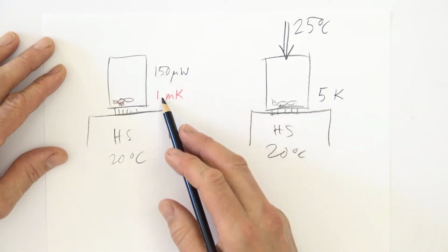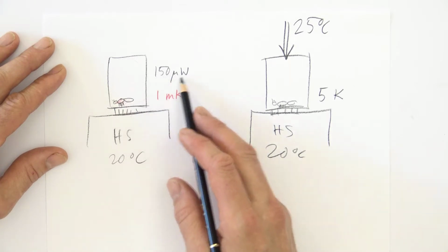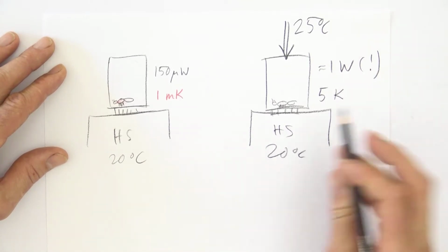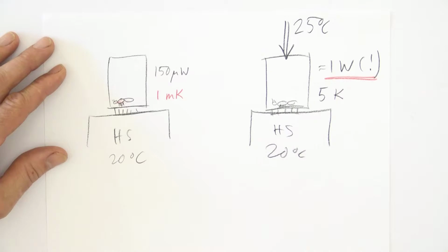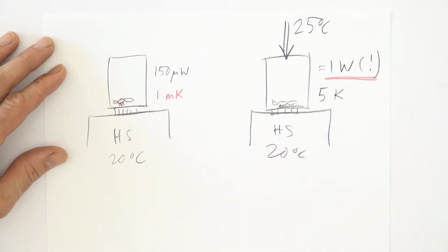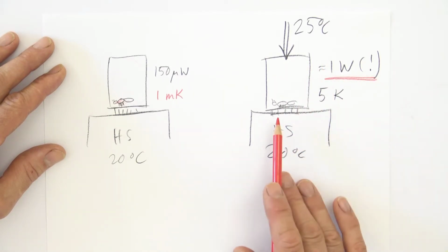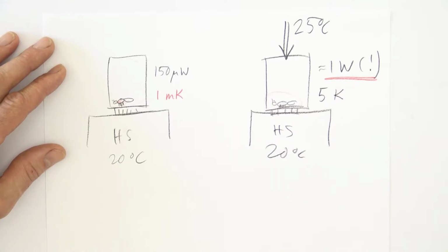Now, just looking at these numbers here, there is a proportionality between the temperature difference and the thermal power. 5 K corresponds to approximately 1 watt. And this is a huge thermal power, far higher than can be measured by normal isothermal calorimeters. This thermal power means that the calorimeter goes far out of range. And this is initial disturbance, and these very high thermal powers and very high signals that we get are not at all caused by the insect. They are caused by the wrong temperature of the vial.